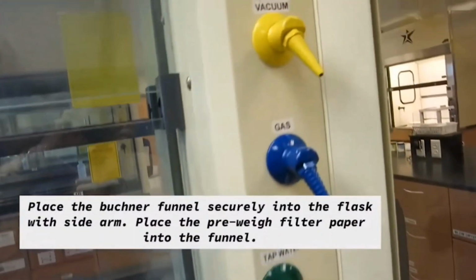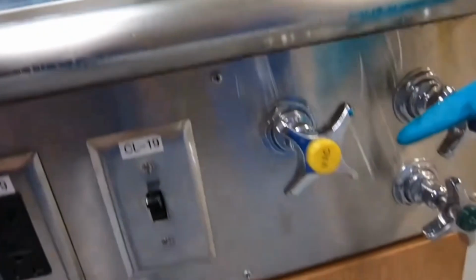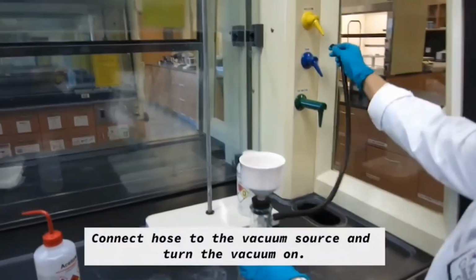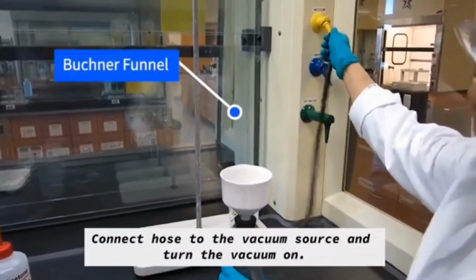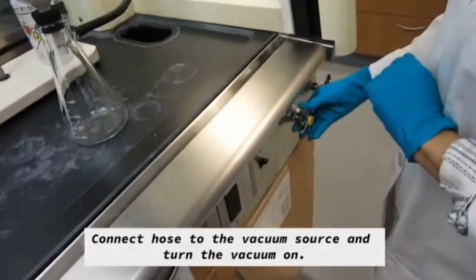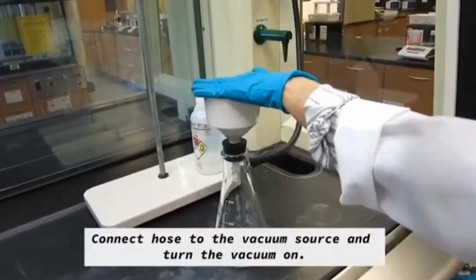So now we're going to be doing the vacuum filtration. So you will have to use a pre-weighed weighing board and a filter paper. Turn on your vacuum.